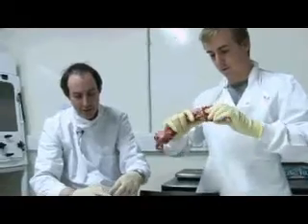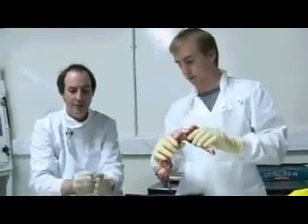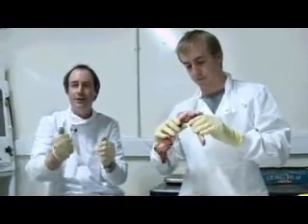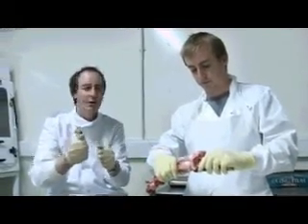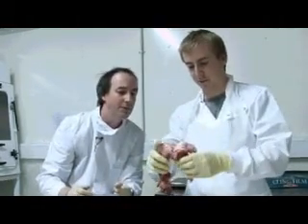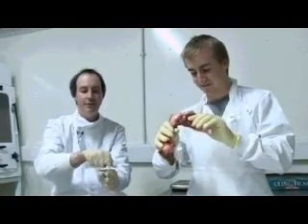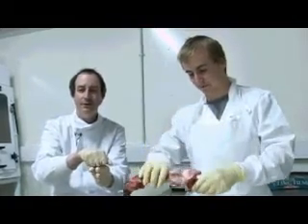If we were testing that I guess we'd want to be pulling it in that direction. The collateral ligaments go on the side of the joint and they stop the joint opening up when you try to bend it in a sideways plane. The cruciates are inside the joint — we'll get to those in a bit — and they're what stop the knee joint shearing backwards and forwards.